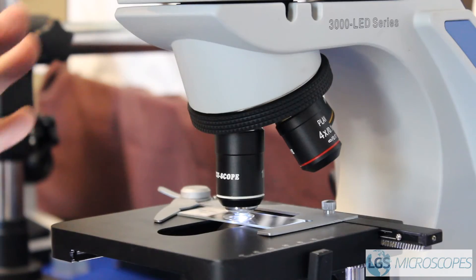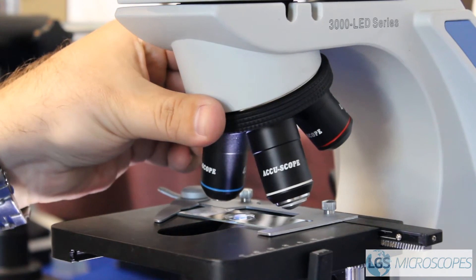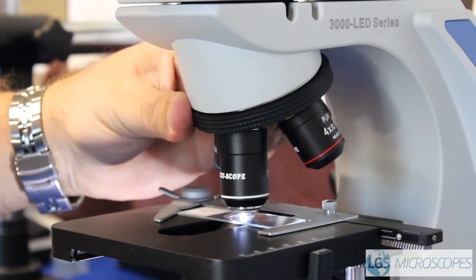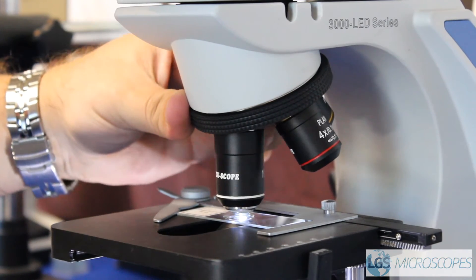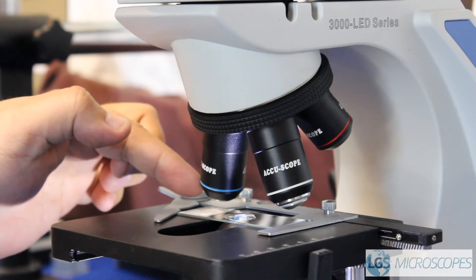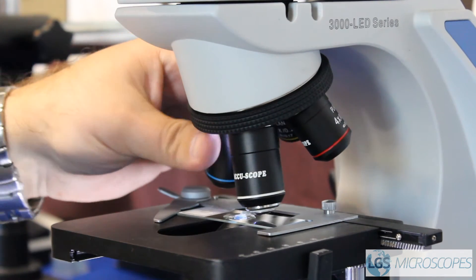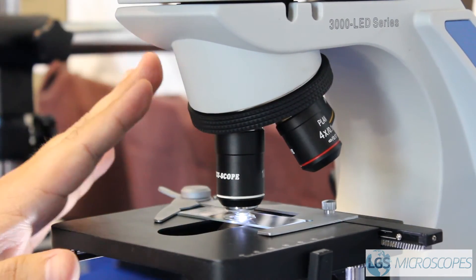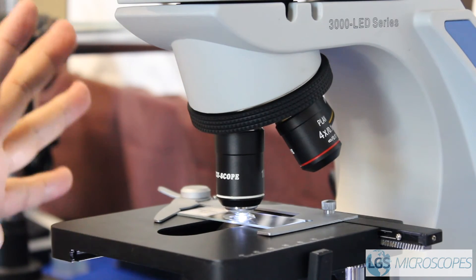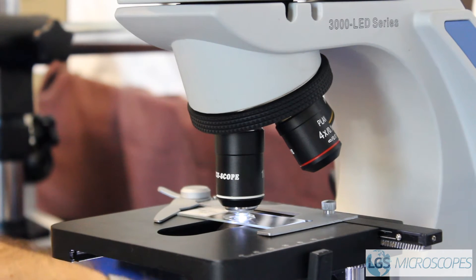Now the most important thing is not to go backwards onto the 40x once you've got oil on your slide and on your objective, because what's going to happen is you swing back and the 40 is close enough that you're going to get oil on there — and it's not sealed to protect the objective from that. So you only want to use the 100x when you're completely sure that you've looked at everything you need to see on the 40, the 10, and the 4x objectives.